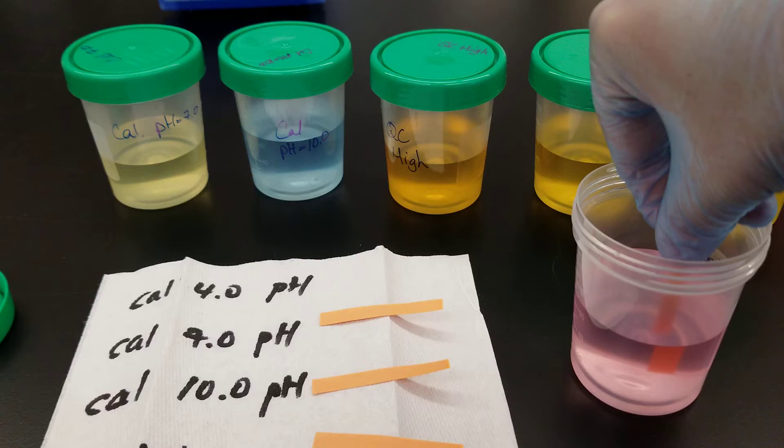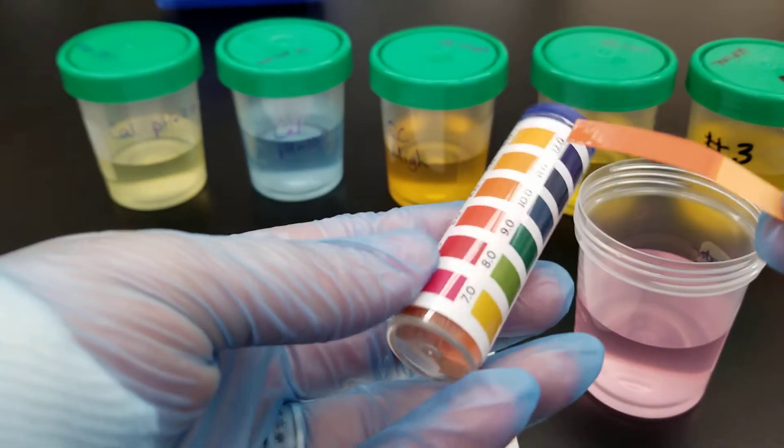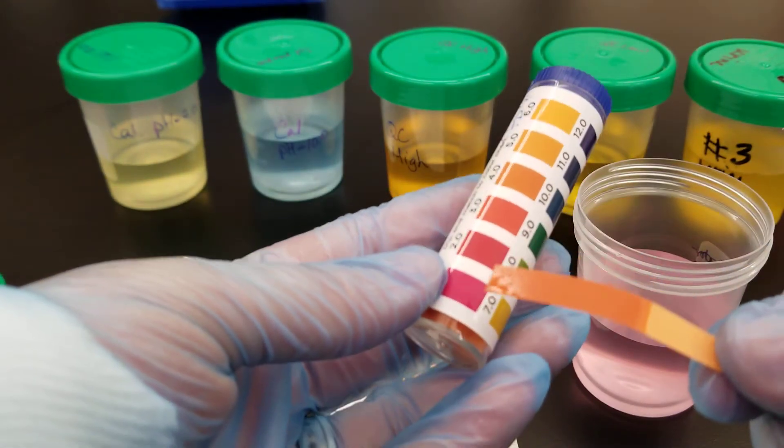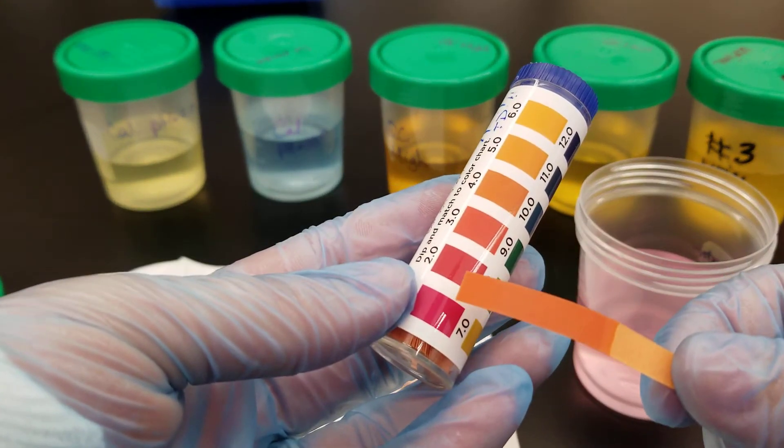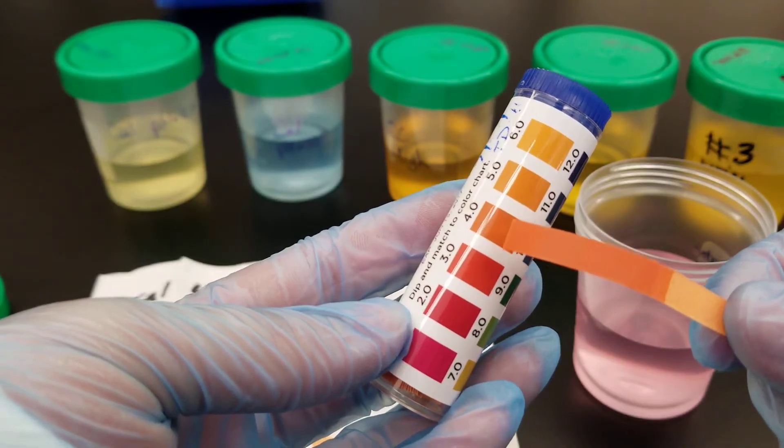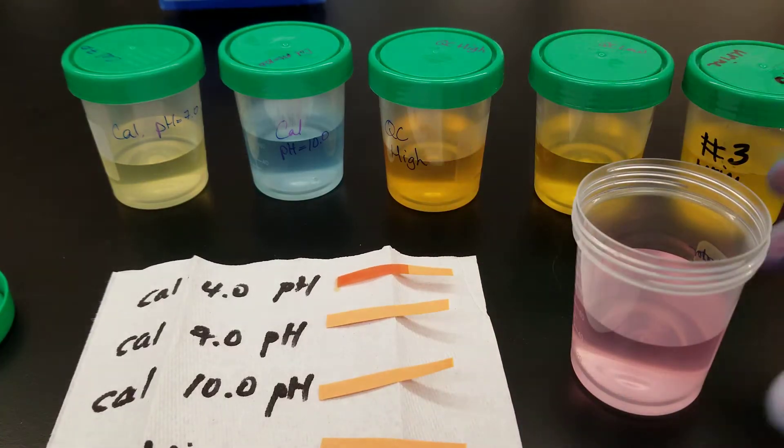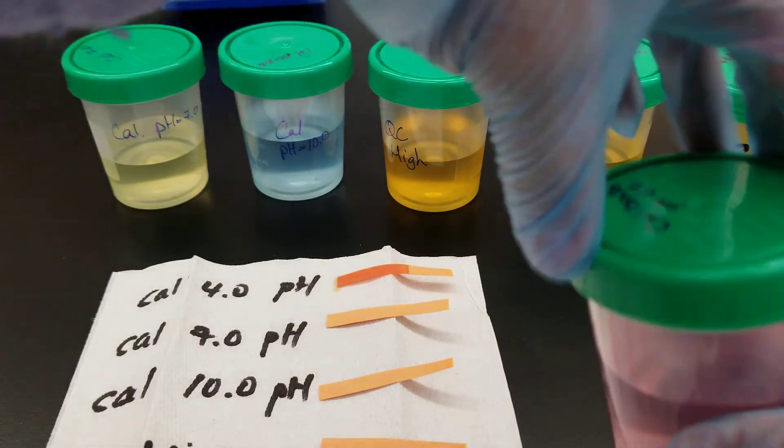You're gonna dip and pull any excess off, and you have to read it while it's still wet. We're looking here and it looks lovely. It does match that pH 4, so that works out nicely. So far very accurate.